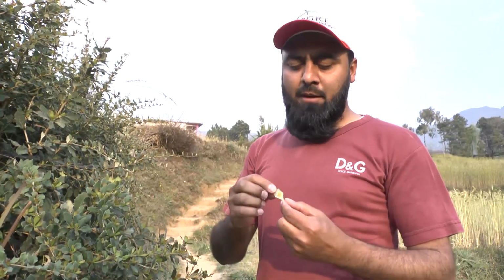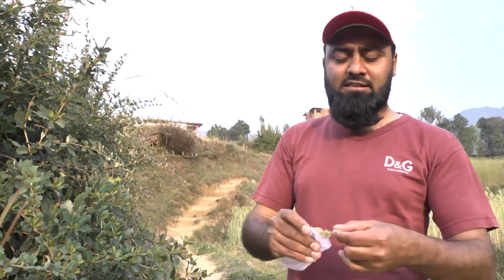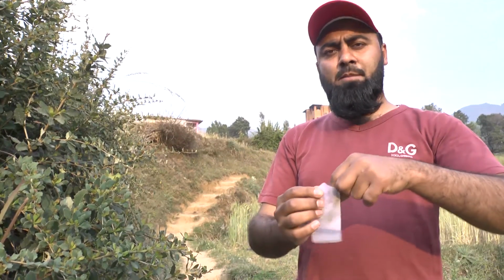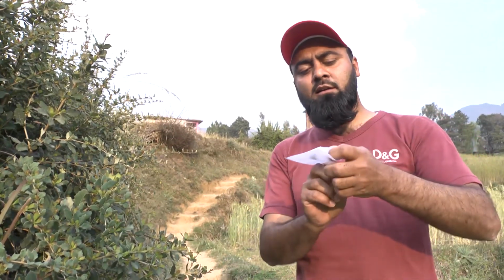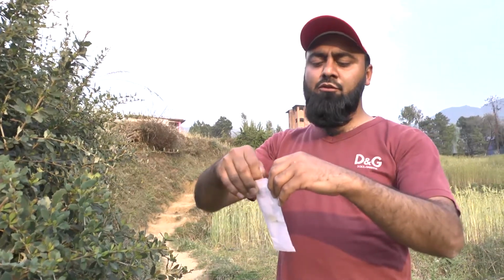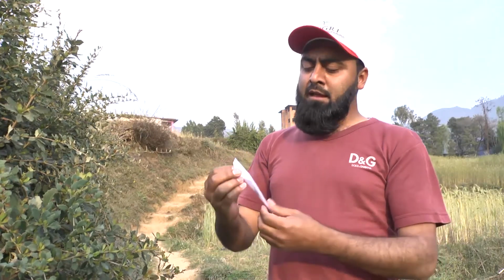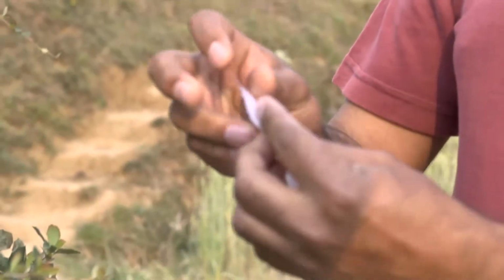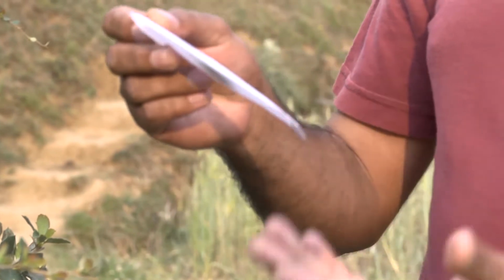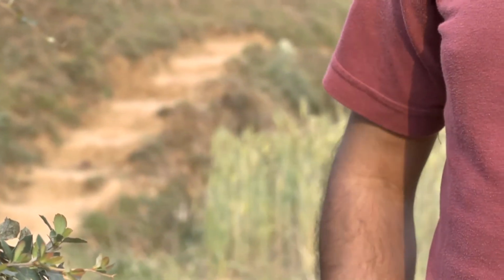The one is to do a biological test, and for the biological test you have to take the whole sample, and that whole sample you have to put in glassine bags. These are the bags which are commonly used by the breeders during emasculation and crossing, but if you don't have these bags you can simply use paper bags. You put the leaves in this, and for biological tests the more leaves we take, the better it is.